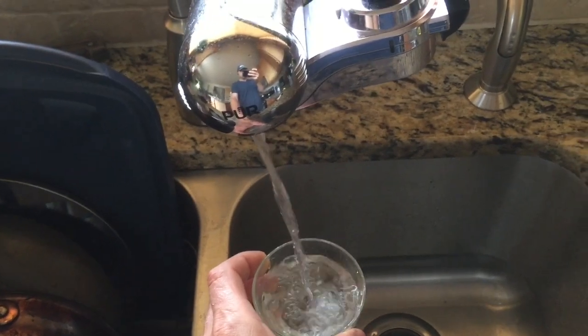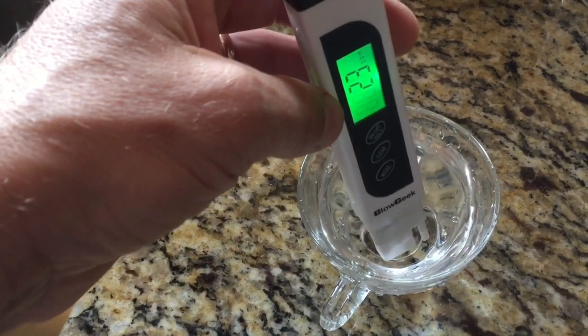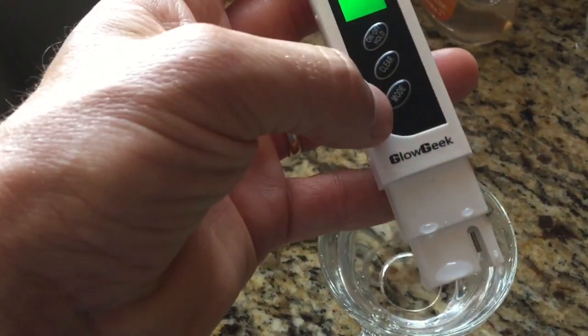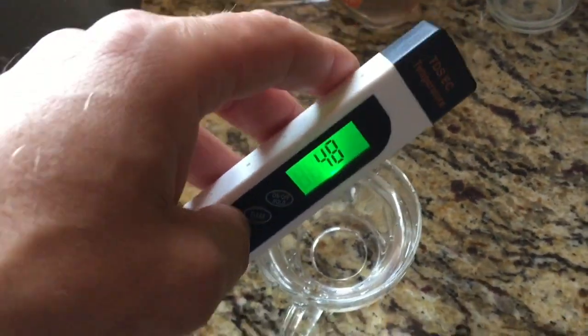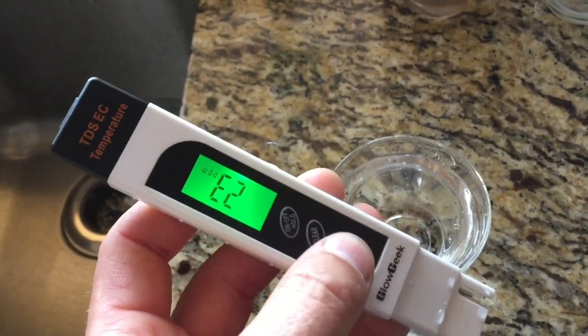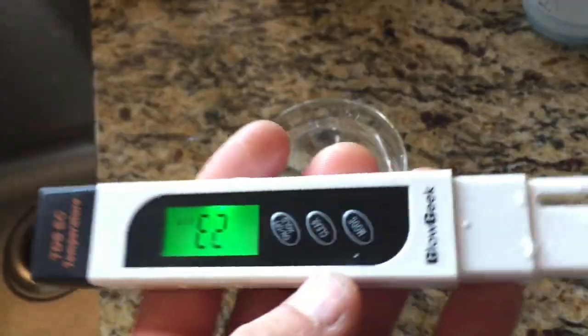It didn't seem right to have the exact same reading as the non-filtered water, but two tests confirmed the result is exactly the same. So I'm going to change the filter and check the results. Now I've removed the old filter and put the new one in. This is before the five-minute runtime.